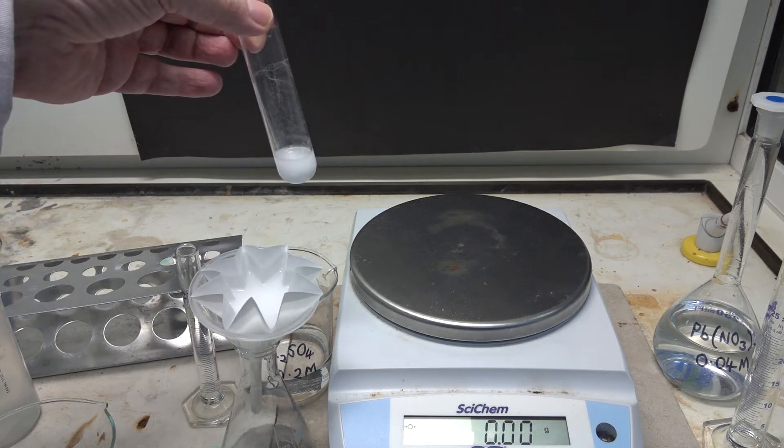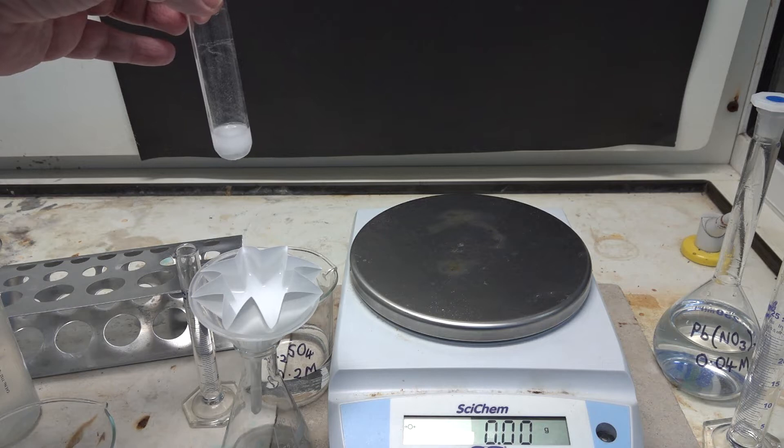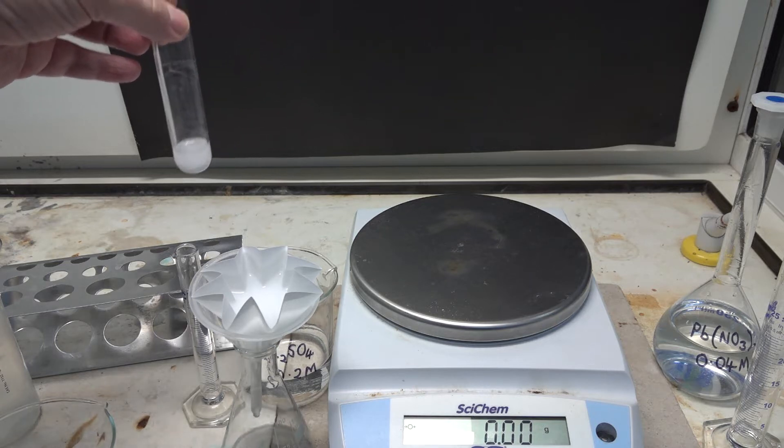You can see we've got rather more than the filter paper will take on one run, so we'll pause the video and wait for that to filter through.